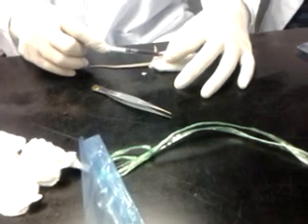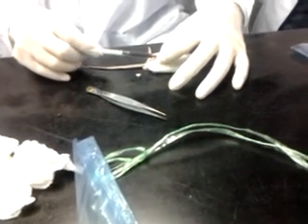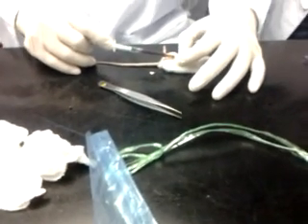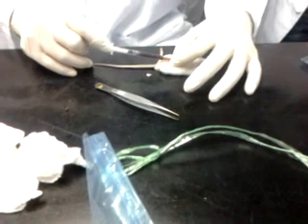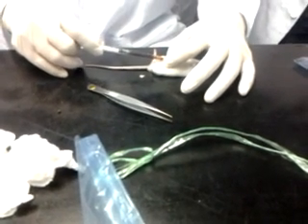Maximum blood, 2.5. So no need to kill, because the animal is already dead after the cardiac puncture, so you can get your blood. It would still be alive after that if it were minimal. This is the technique of cardiac puncture.